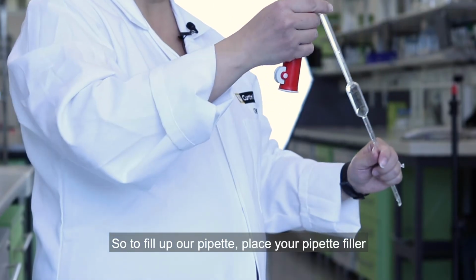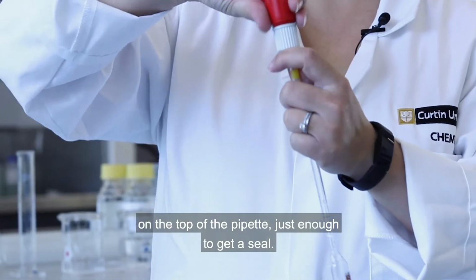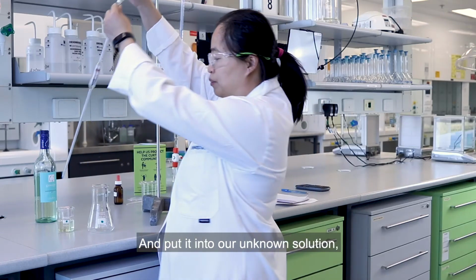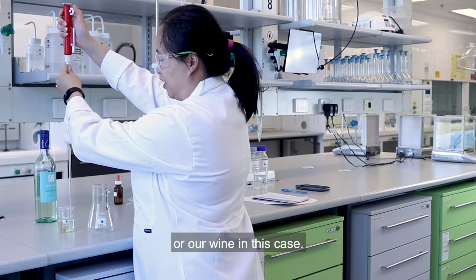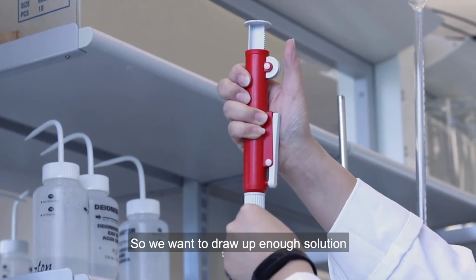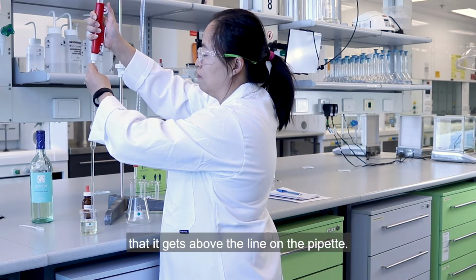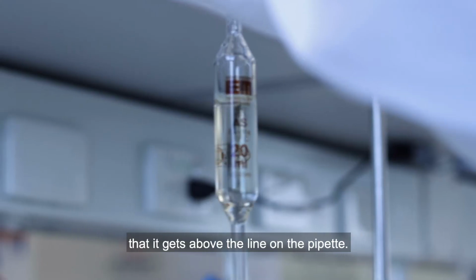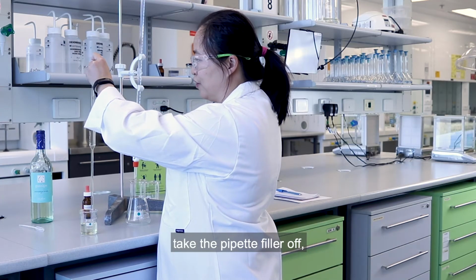what we want. So to fill up our pipette, place your pipette filler on the top of the pipette, just enough to get a seal, and put it into our unknown solution, or our wine in this case. And we start drawing up our solution. So we want to draw up enough solution that it gets above the line on the pipette. As soon as the line is above, take the pipette filler off.